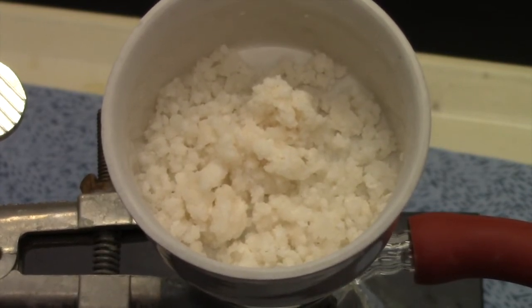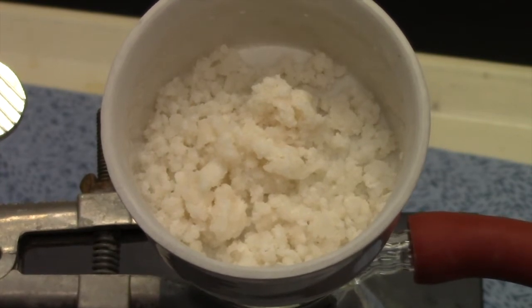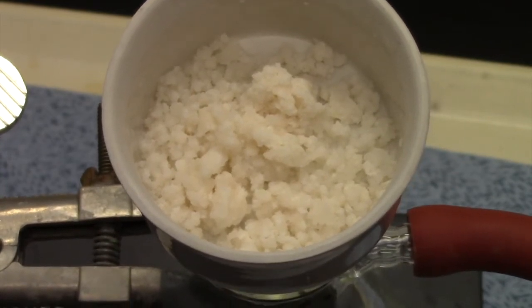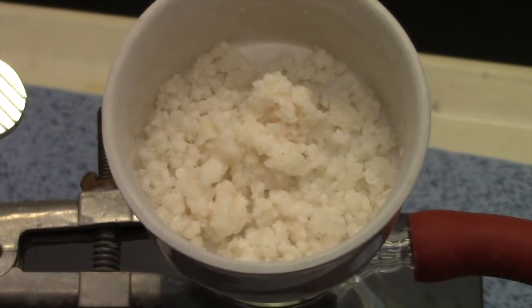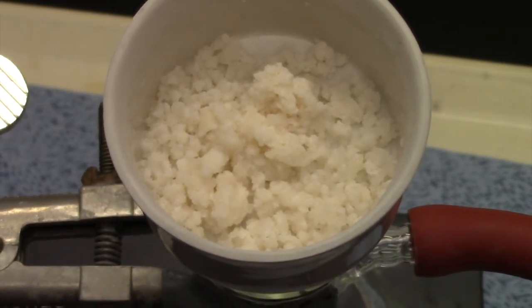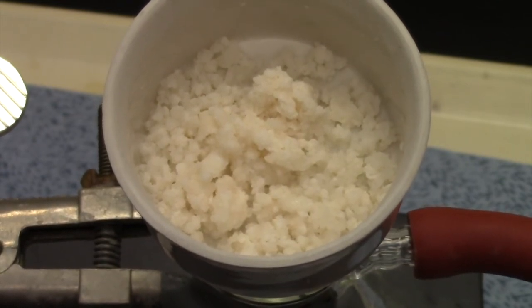Isn't that kind of cool? That is soap right there — we made our own soap. Now the next step is I'm going to do a quick weight of it. It's going to be a wet weight, so the mass of the water is going to be included. The best thing to do if I really had time is wait a couple weeks, let the soap dry, and then get the mass of the soap at that point. But this lab still drives the point home. So let's go weigh it.